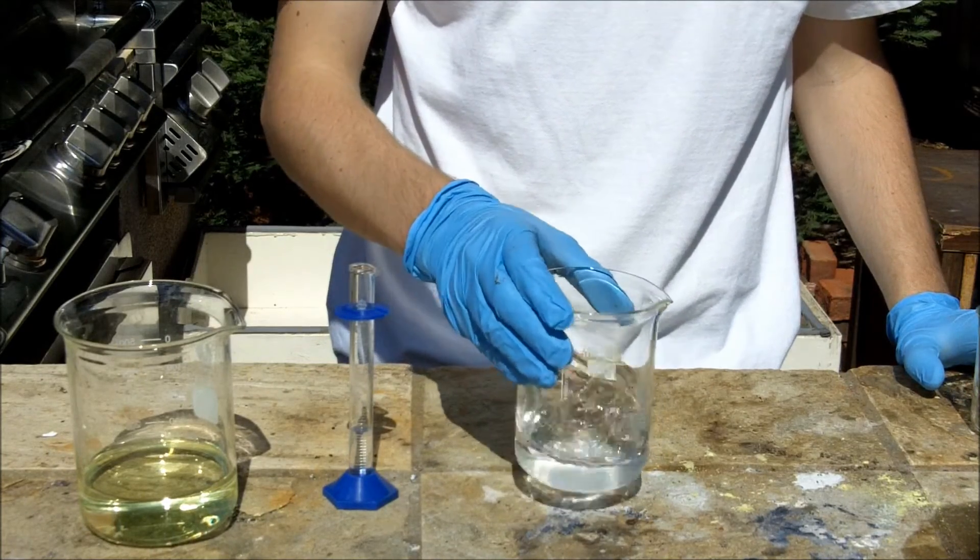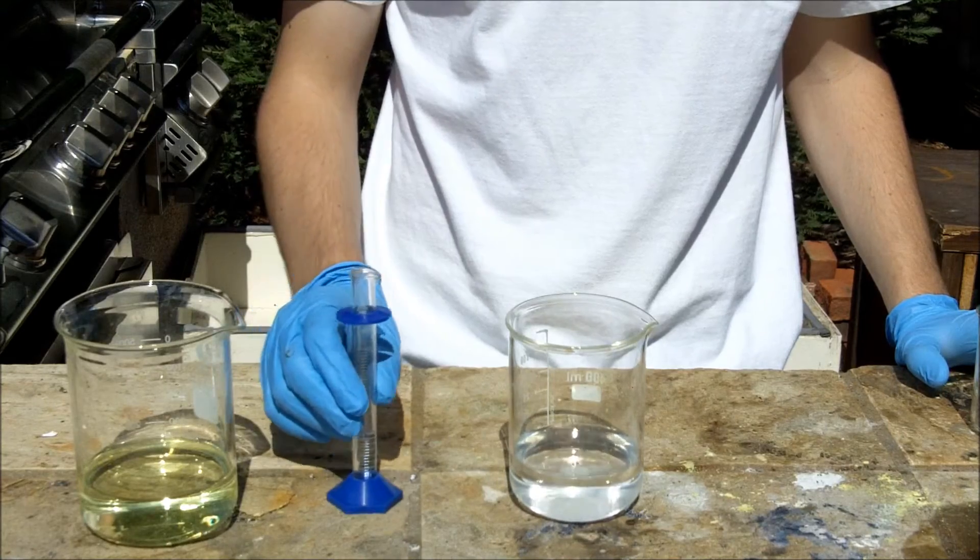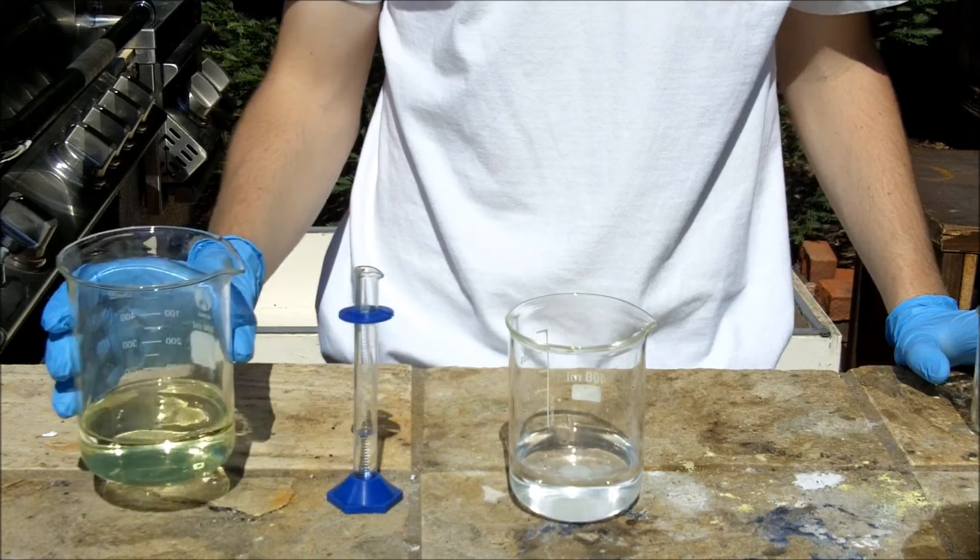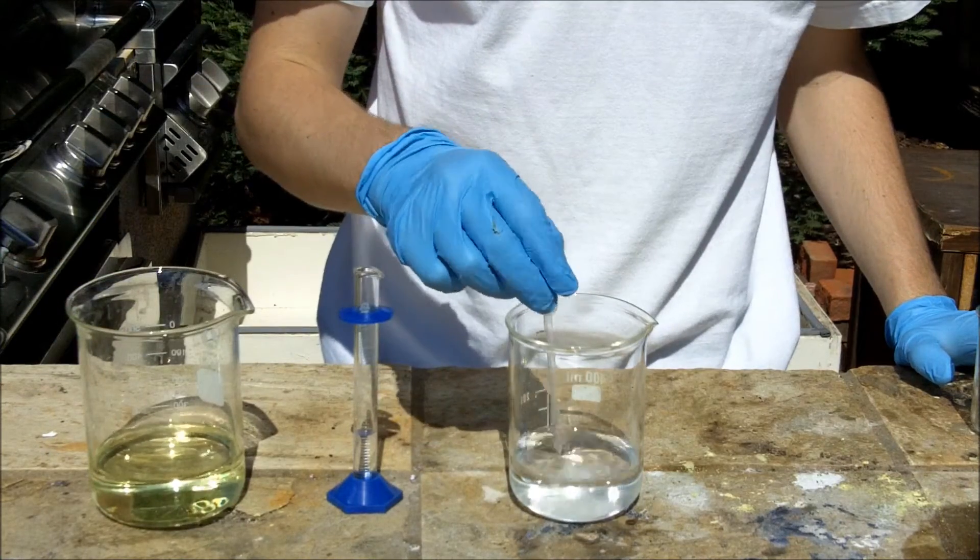All right, to that, I'm again going to add 4 milliliters of acetone and 150 milliliters of bleach. So let's get that all dissolved.